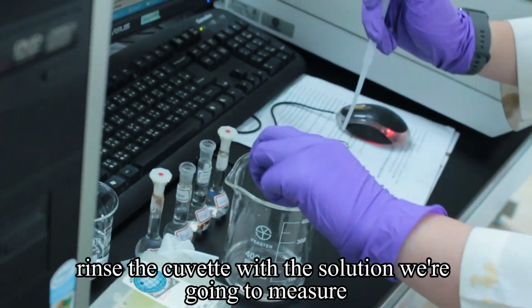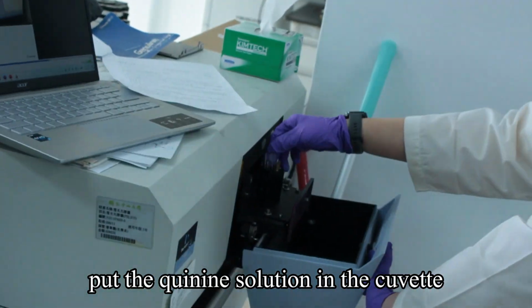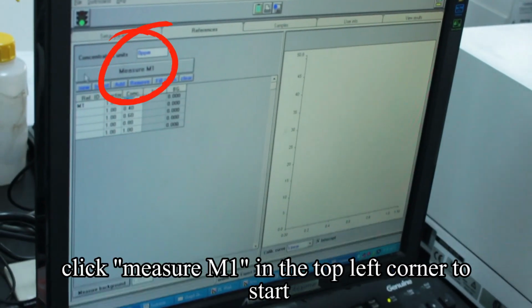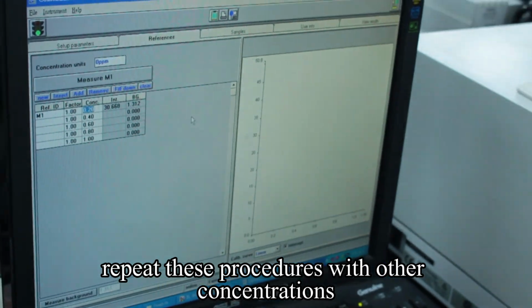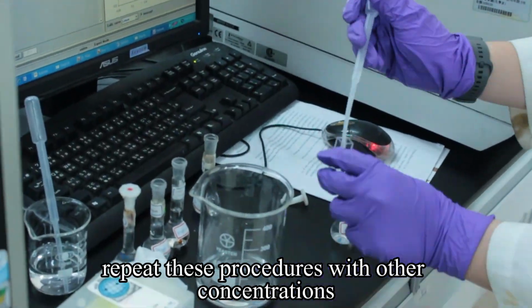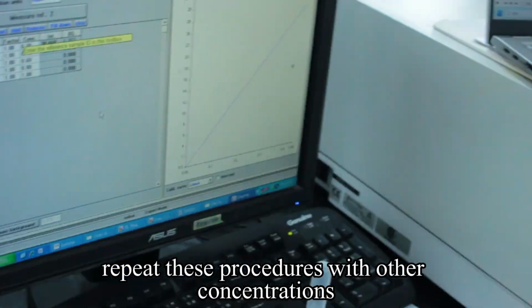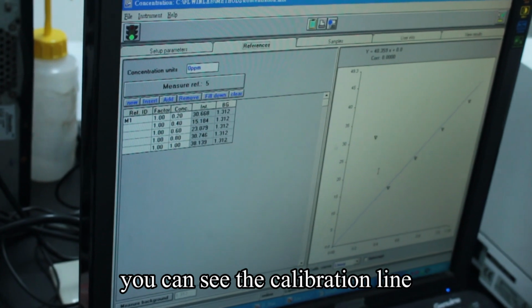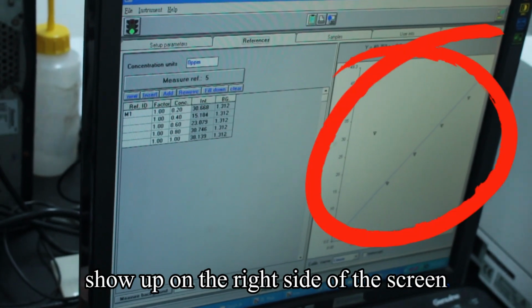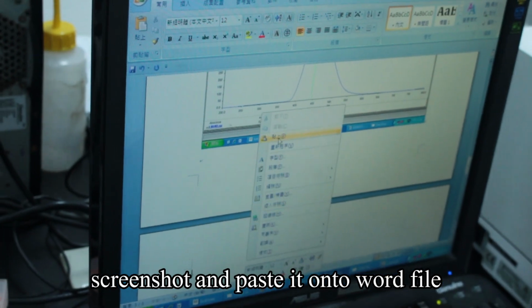Rinse the cuvette with the solution we're going to measure. Put the quinine solution in the cuvette. Click Measure M1 in the top left corner to start. Repeat these procedures with other concentrations. After finishing all the 5 references, you can see the calibration line show up on the right side of the screen. Screenshot, and paste it onto a Word file.